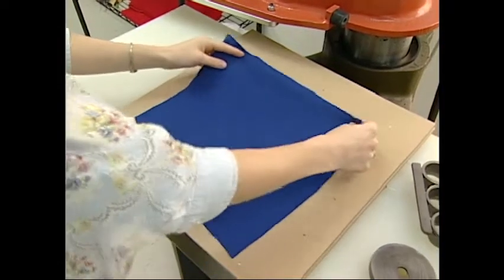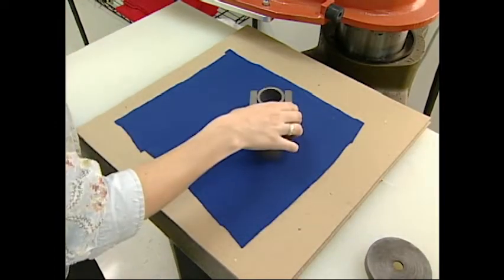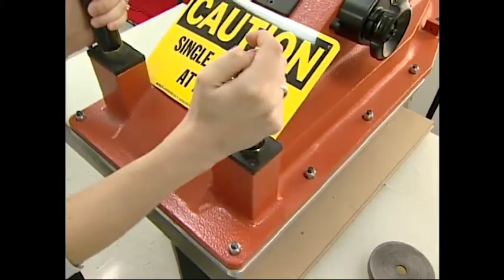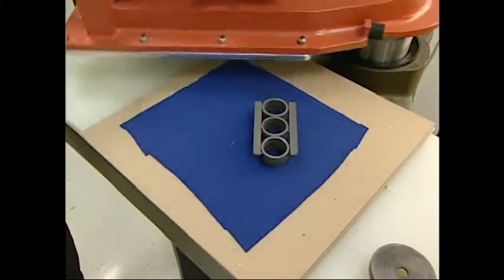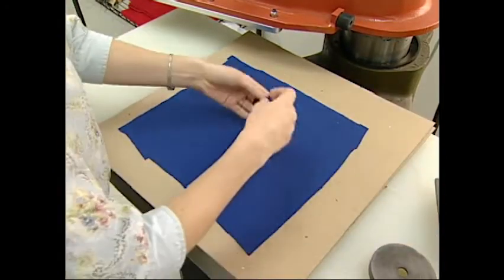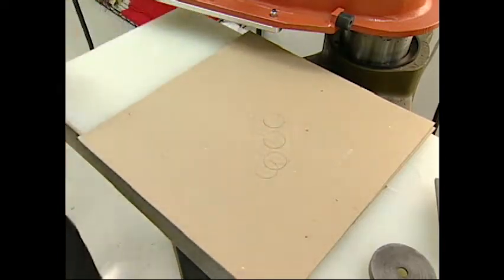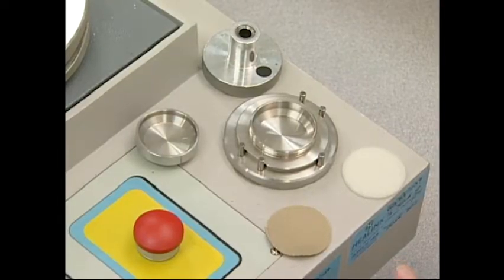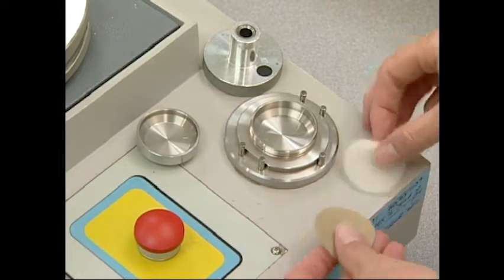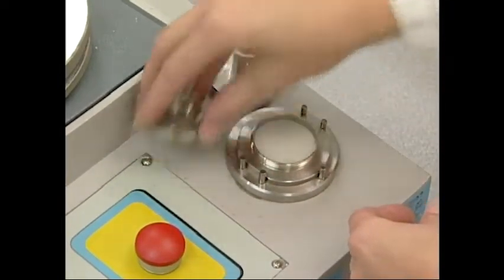These specimens are interlocked knit. Here are the components of the test, displayed for viewing. These include the specimen, the backing pad, the two-part sample holder, and the device for loading and locking the sample into the holder.